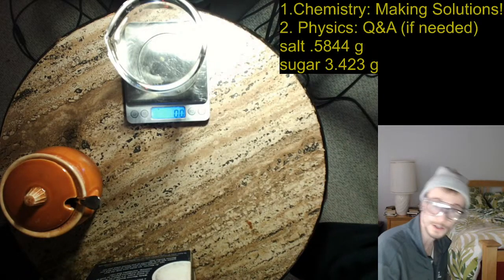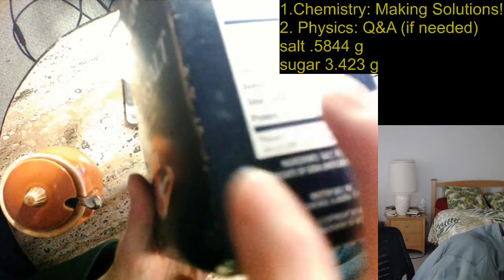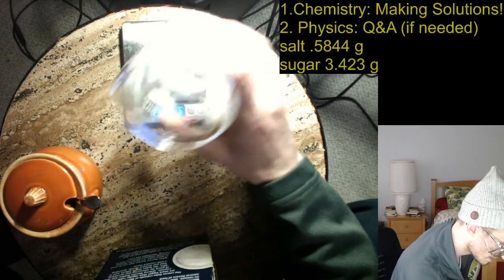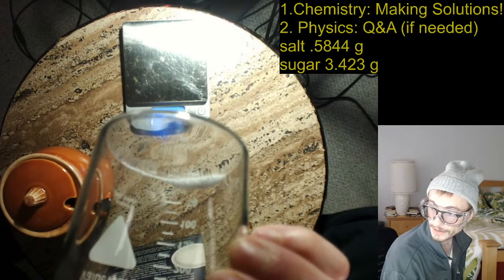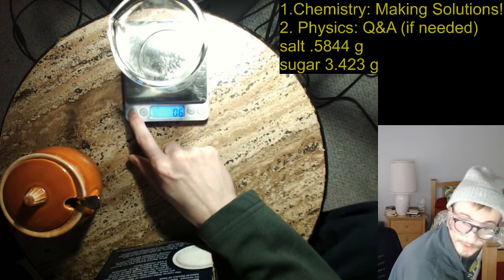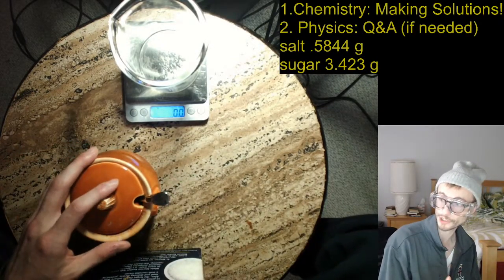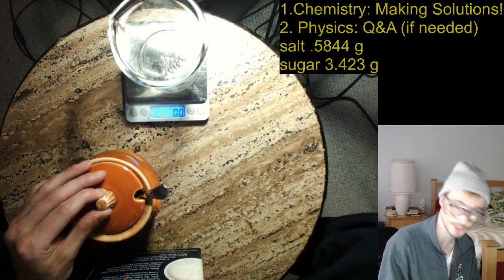So now I'm going to add salt until I have 0.5 grams. It's going to be pretty tricky because I have a decent amount of salt in here. Bam, bam, bam. 0.5, I already got 0.6. So maybe you can see this is really not a lot of salt, just a tiny bit. Really, really small amount. Now, I'm going to re-tare the scale, and I'm going to do the same thing, but this time I'm going to add sugar. Now, notice that I'm adding much more mass of sugar than I am of salt. So I'm adding almost like 6 times as much sugar as I'm adding salt.